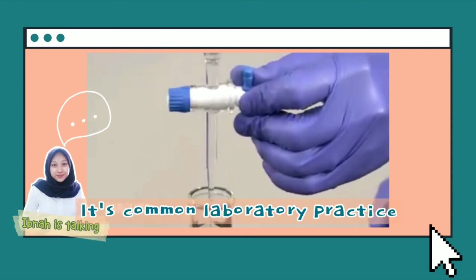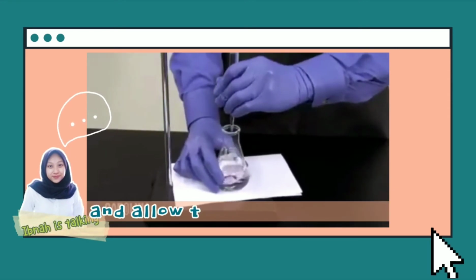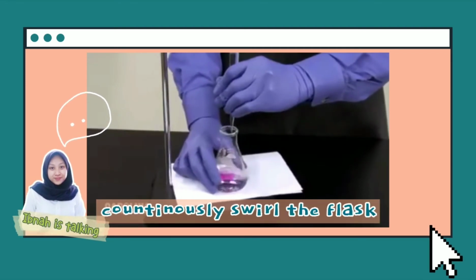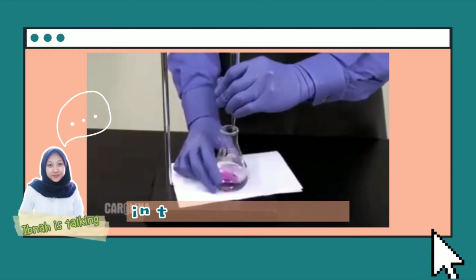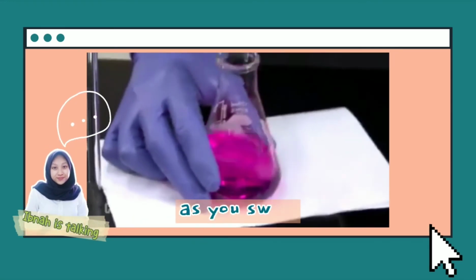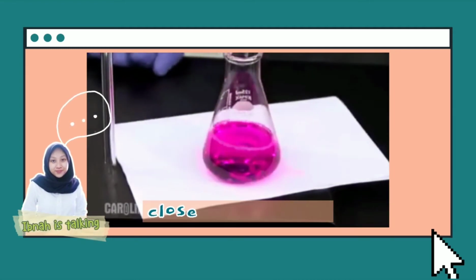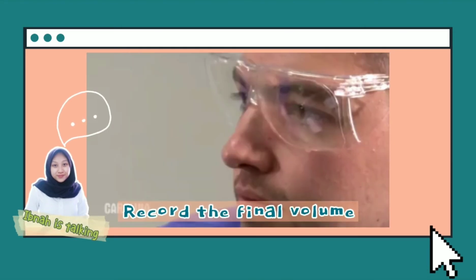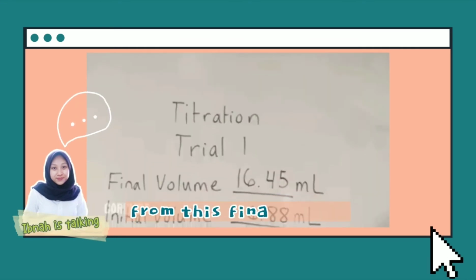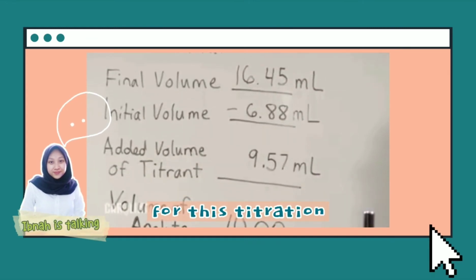It is common laboratory practice that the first titration is an estimate. Open up the stopcock and allow the titrant to enter the flask. Quickly and continuously swirl the flask. As the volume of titrant in the flask increases, the color of the indicator appears and disappears as you swirl. When the analyte becomes a colored solution, close the stopcock. Record the final volume of the burette. Subtract the initial volume from this final volume to get the estimated volume of titrant needed for this titration.